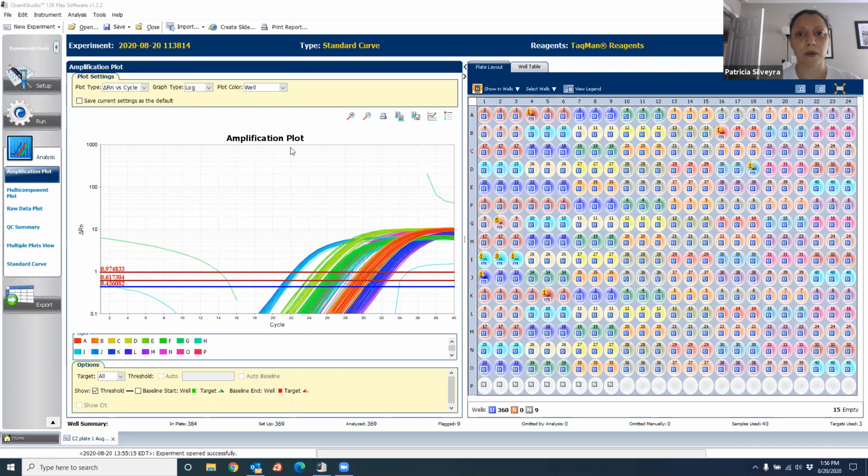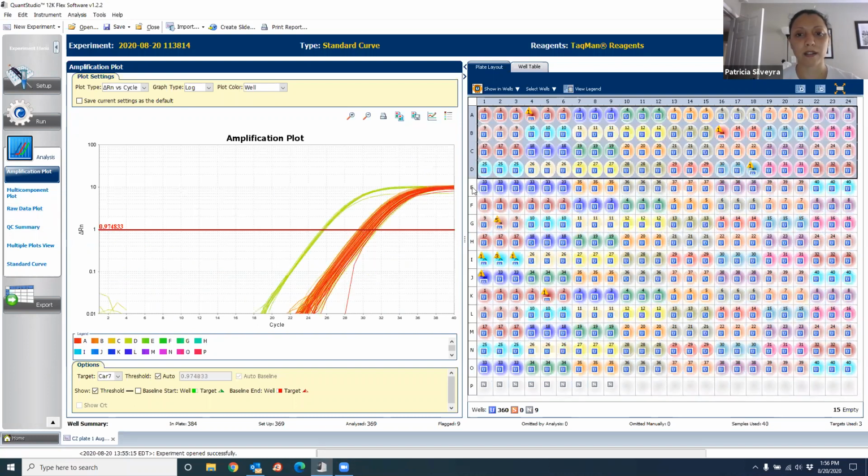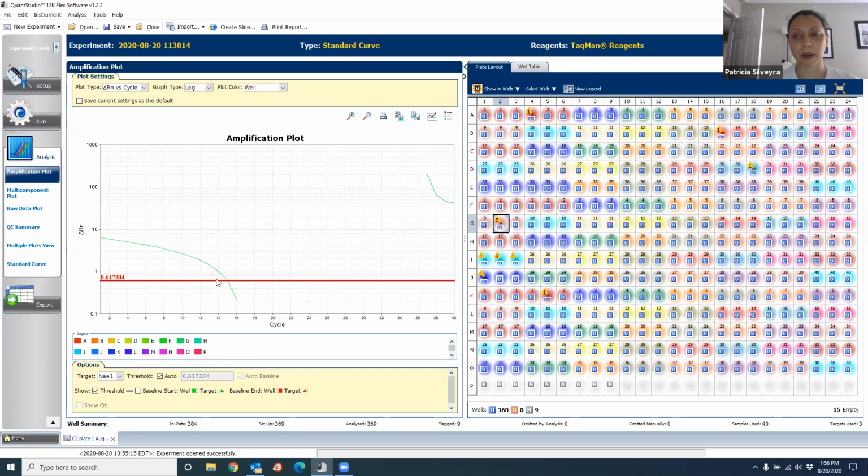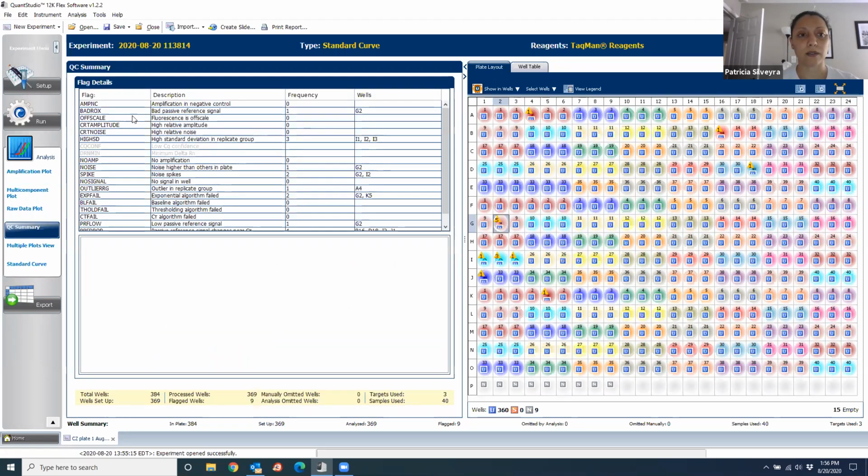One is to go one by one and find where they are. Like, if you just go one by one, see, it's in line G, and then you see this number 5 over here, you know that that is the bad well. So you can just one by one identify those wells, or you can go here on the left side where it says quality control summary, and you click there and it's going to tell you, okay, G2 has an issue. I1, I2, and I3 have an issue. In this case, it says there's a lot of noise on G2, which is what we identified earlier. So what you can do is omit that well.